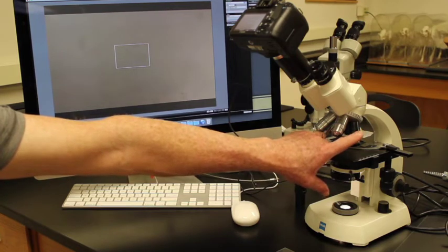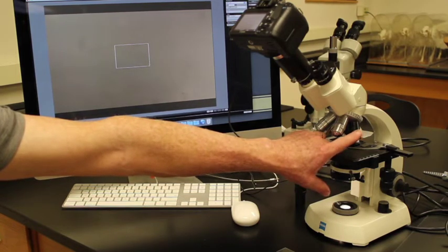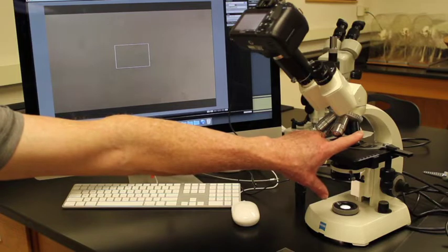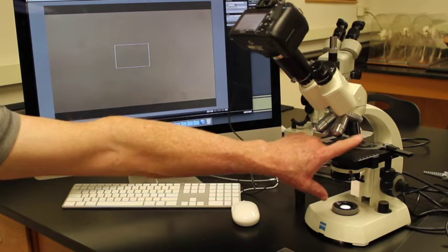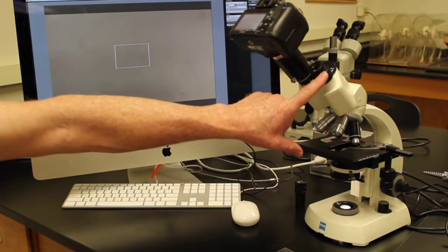Our 100x is our maximum and is designed to be used with oil. We will use the 100x at the end when we look at bacteria. That 100x times the 10x ocular is 1000x total magnification.